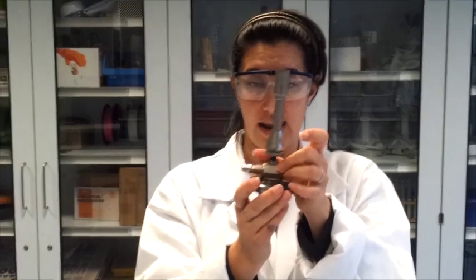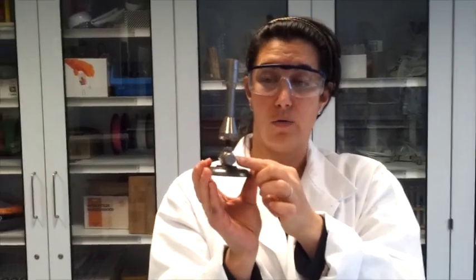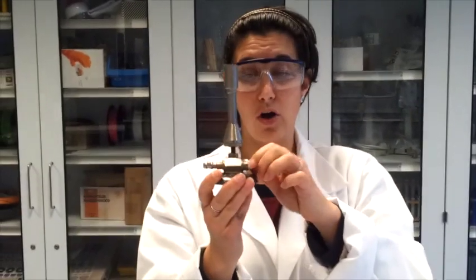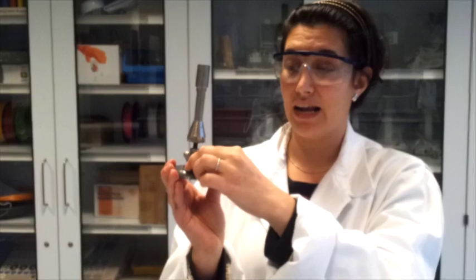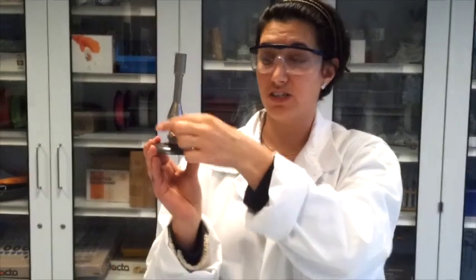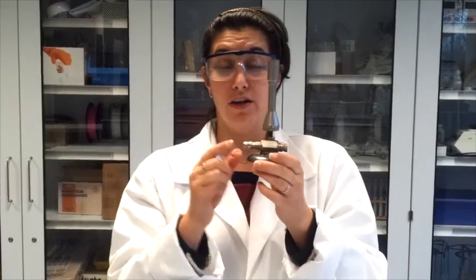This is open and now it's closed. Over here we have the gas knob or the gas valve. We open it turning it counter-clockwise, so that's against the direction of the clock, and we close it clockwise. And on this side we have the fitting for the rubber tubing. This is my rubber tubing.